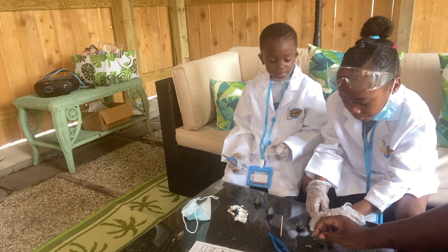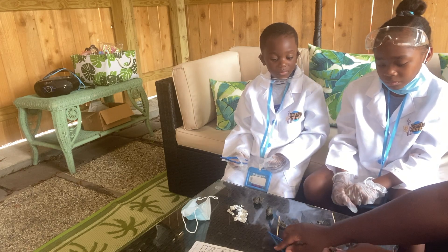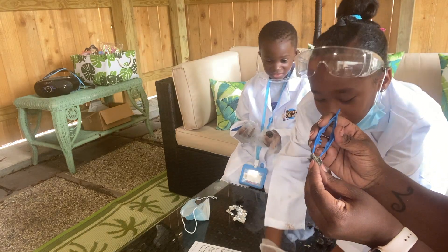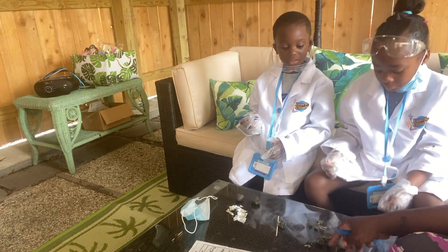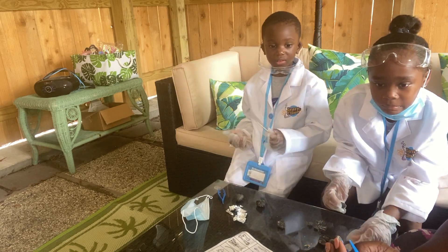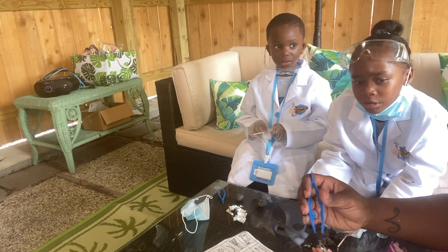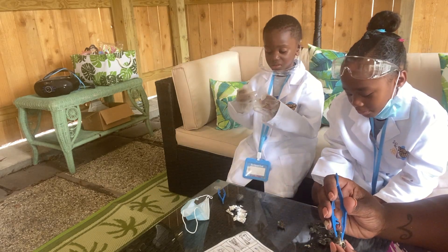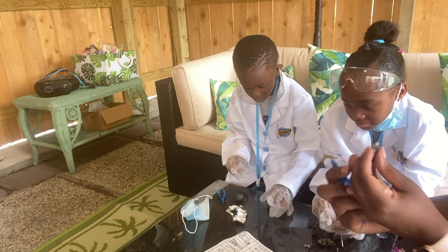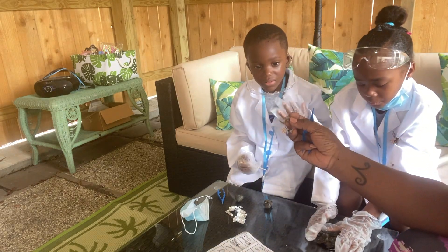That is disgusting. You still have to figure out what it is. You can't open up another one without knowing what this one is. But look at this one — it has a nail. Look, it's a rodent. Touching a rodent — a rodent is like a mouse or a rat. See, look at his two teeth. That's the mouse! Poor little mouse, look at his little teeth. So this owl just ate the entire mouse.